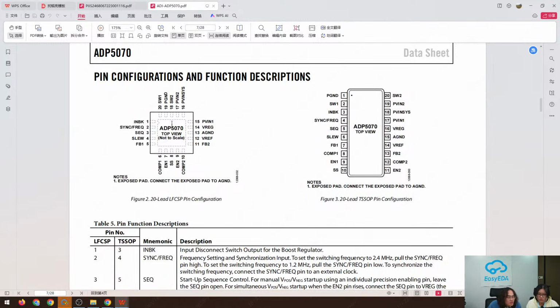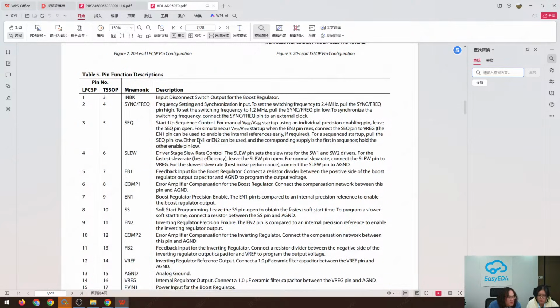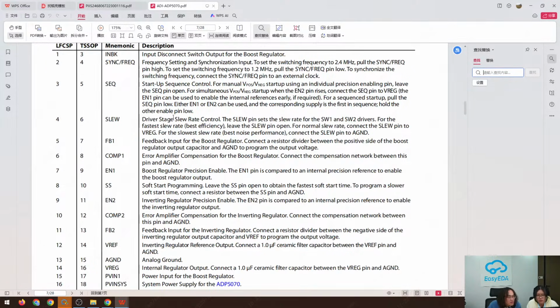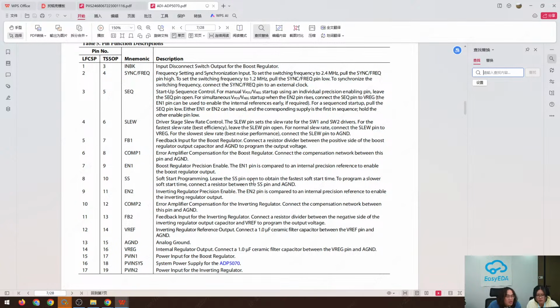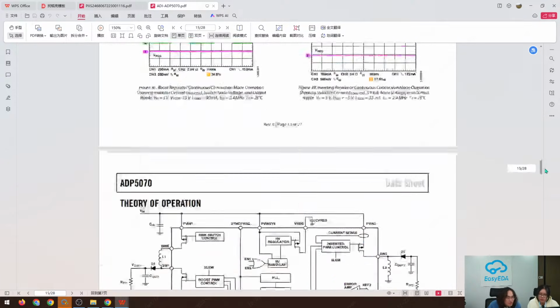So this chip has two kinds of package. The QFN one is what I'm currently using. But if you think this one is difficult to solder, we can use this other package, the TSSOP. I'm sorry, this is the LFCSP package. This one is easier to solder, but it depends on your project. And down here is the pin definition. We can see a lot of pins here with different functionality. We will go through the details. In today's session we just go directly to the typical application circuit.